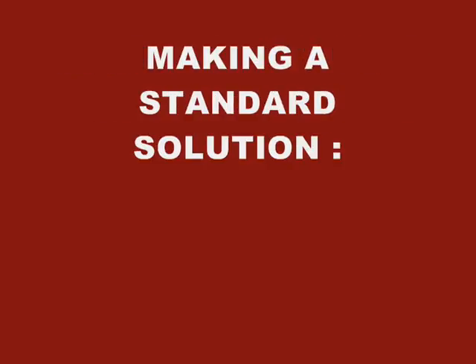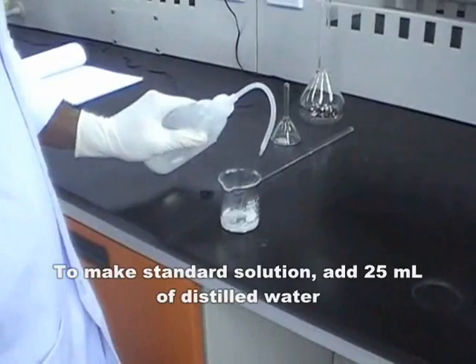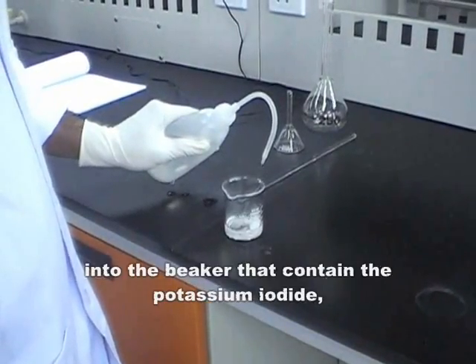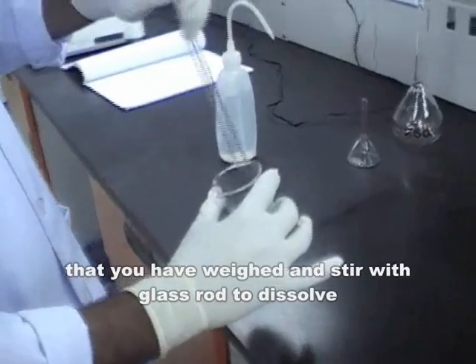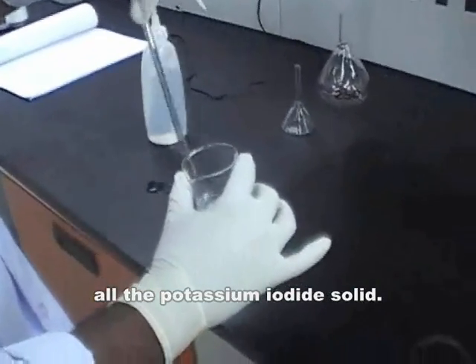Making standard solution of potassium iodide. To make standard solution, add 25 ml of distilled water into the beaker that contains the potassium iodide that you have weighed and stir with glass rod to dissolve all the potassium iodide solid.